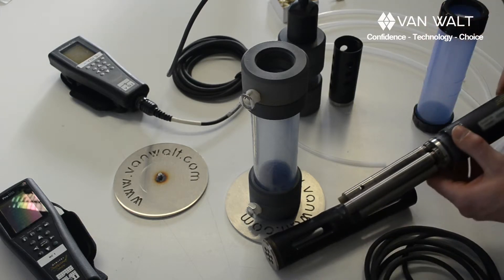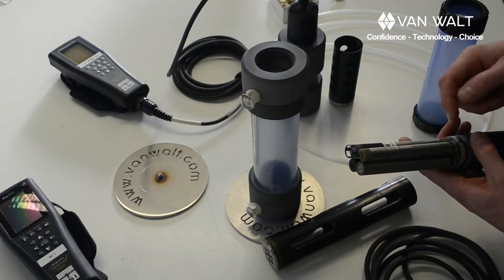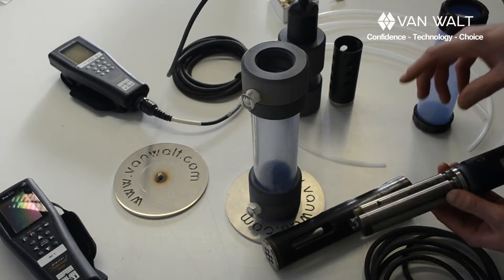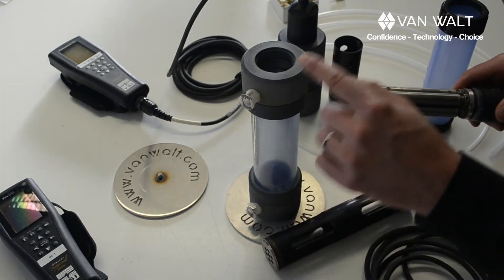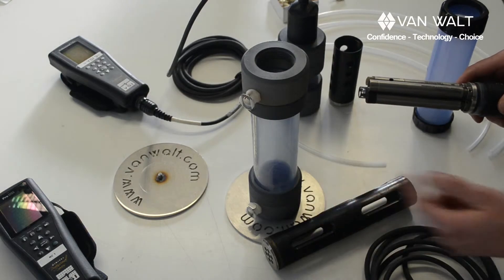The other thing is these ports — if they get a little bit of water inside them then that's going to upset the sensors as well. If you have the flow cell on its side you've got more chance of forcing water into there, especially if there's a little bit of pressure through this flow cell with water coming in and coming out.